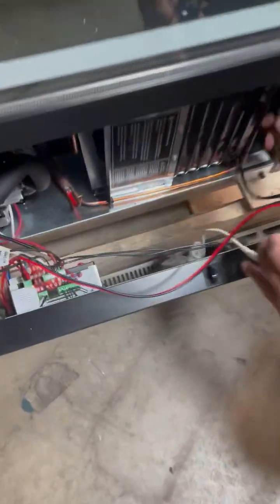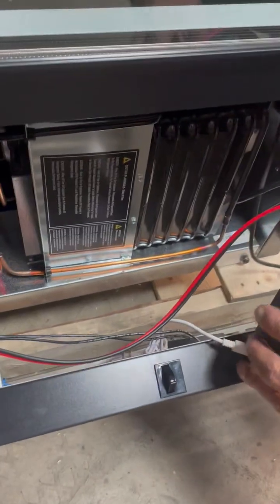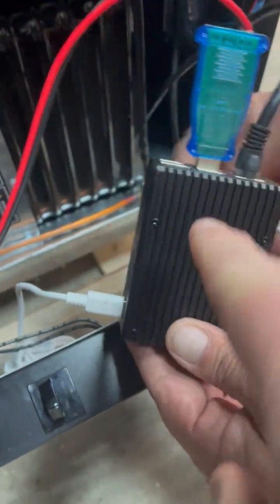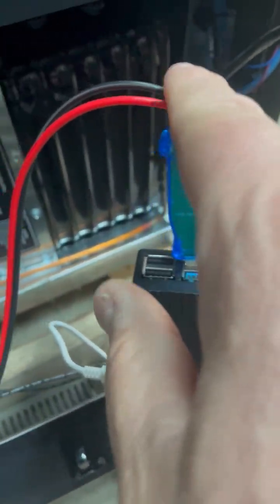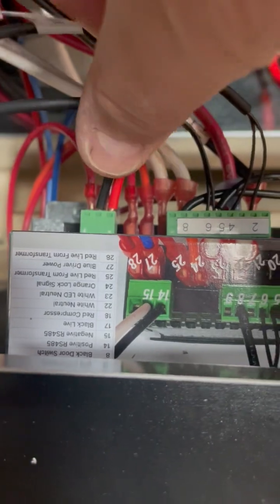This is a quick video on how to set up this Raspberry Pi to a freezer. You have your Raspberry Pi, and we are sending you this adapter that simply plugs into the USB. This wire will then get connected right here — it plugs right in.